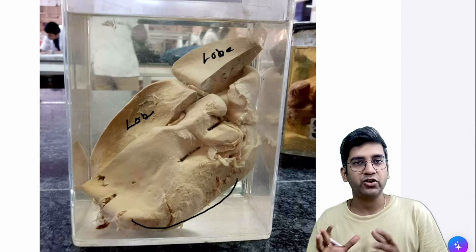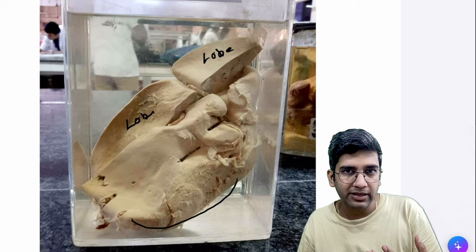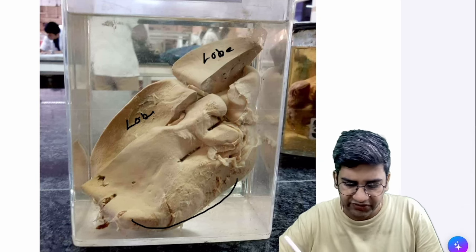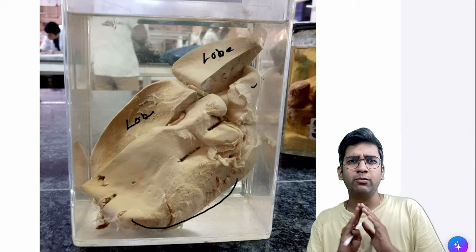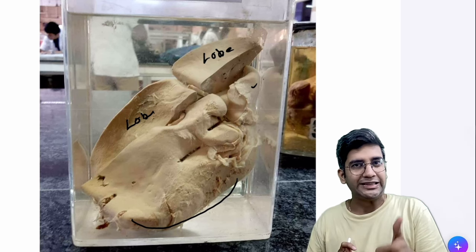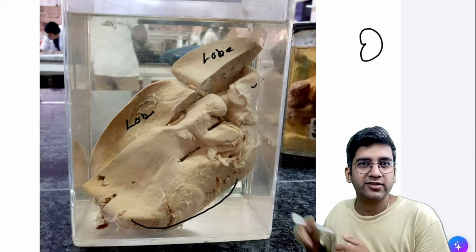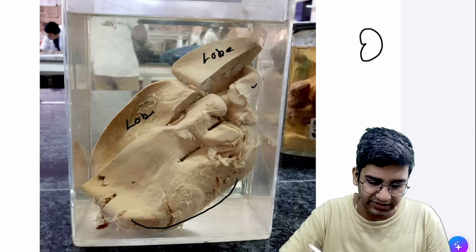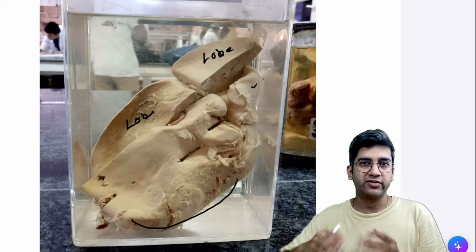Every organ has its own characteristic features. Although I'm not able to see the gallbladder here, if I can see the fossa I can mention the gallbladder fossa. You can also talk about the peritoneal reflection if required, but most of the time liver is very simple to identify. The shape of the organ gives you a classical clue — if the organ has a characteristic shape, like a kidney, you can identify it straight away. So we have shape of the organ, lobes, and a very smooth outer surface — all pointing to a liver.